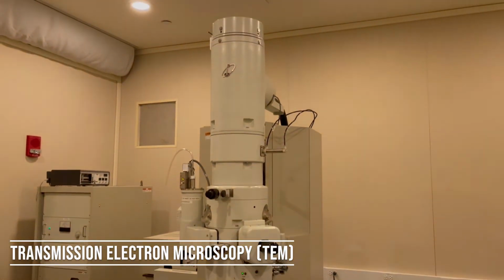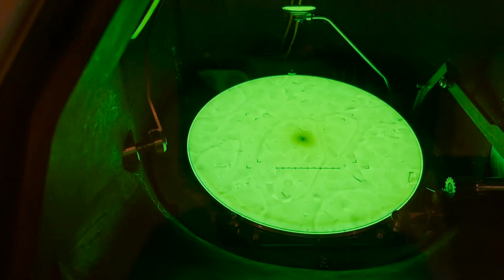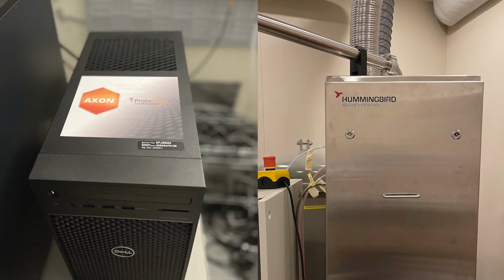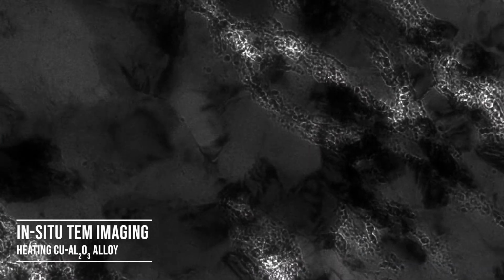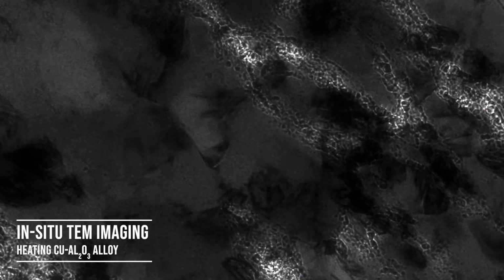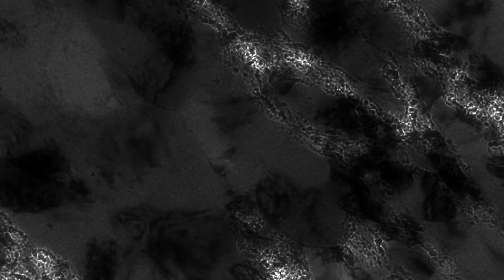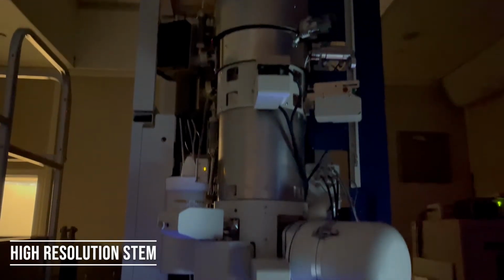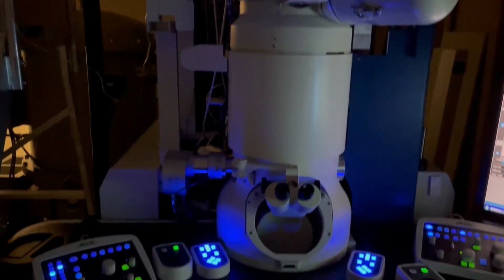Our introductory TEMs allow users to learn how to operate the instruments and are also excellent workhorses for routine TEM analyses. We also have more specialized instruments for advanced imaging and analysis. For example, we can study real-time dynamic imaging via in situ studies, and our CS-corrected STEM allows us to study materials at ultra-high resolution.